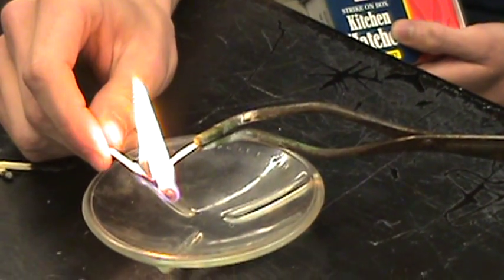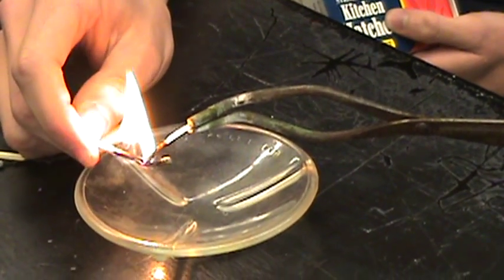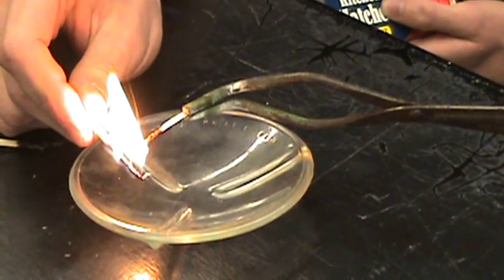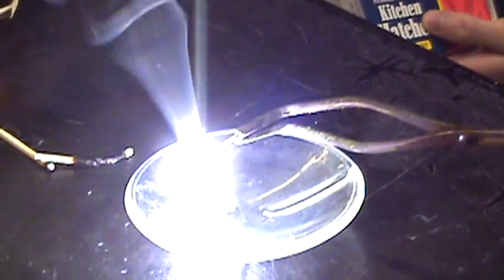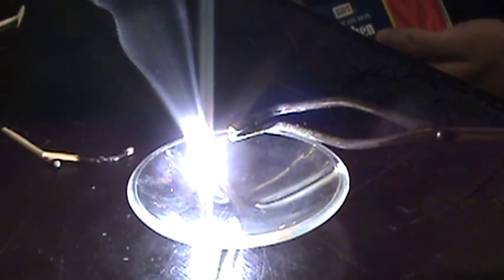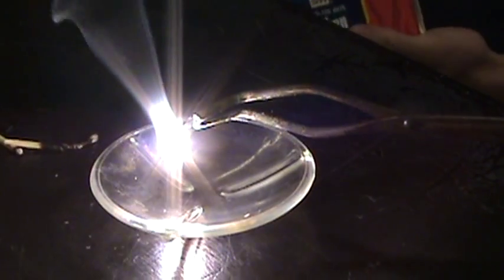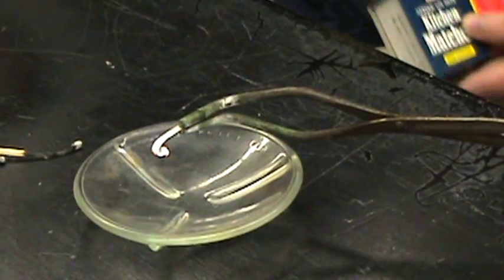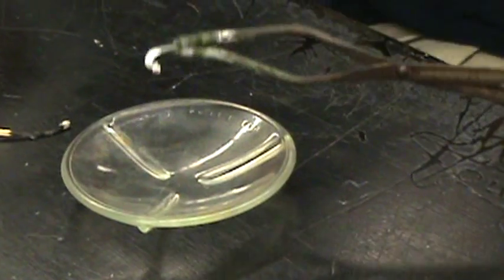It has to get fairly hot for it to ignite. It's one of those burnable metals. Okay, one second... there we go, there we go, boom! They used to use this as flash powder with old-fashioned photography. That is weird. It just went out. Okay, here we go.